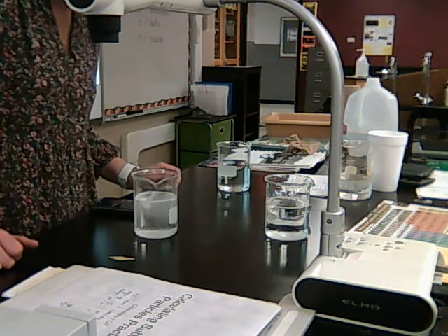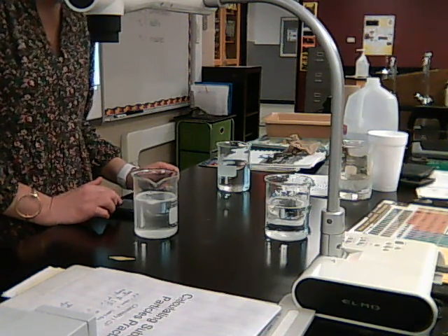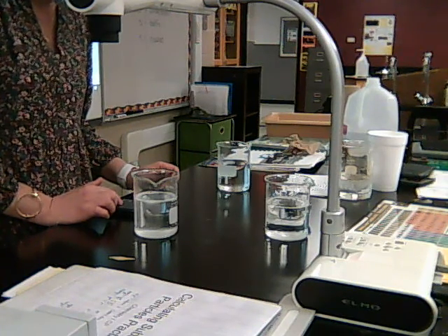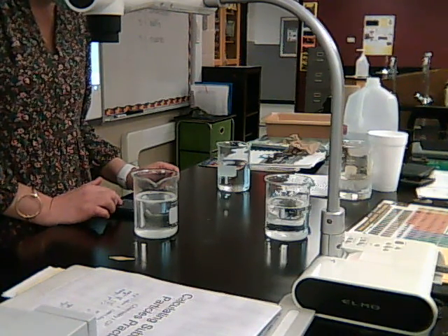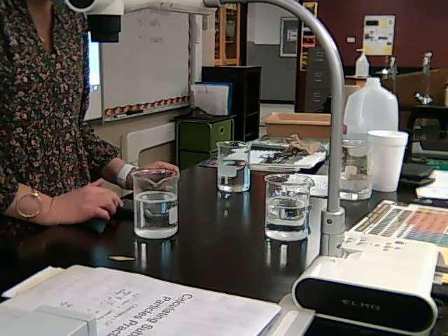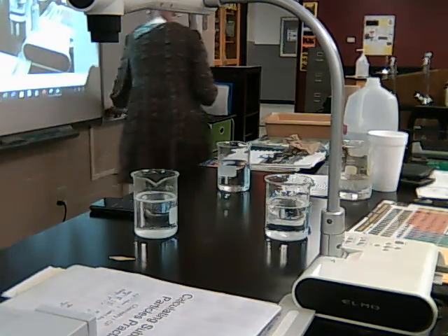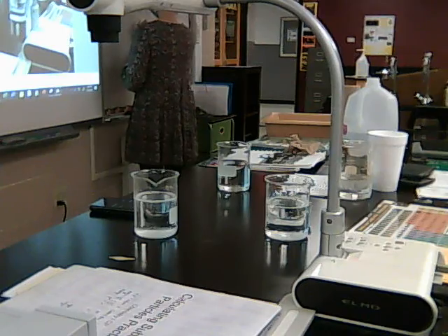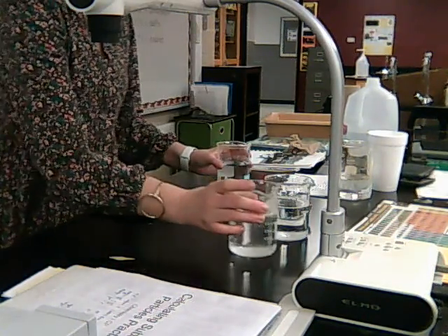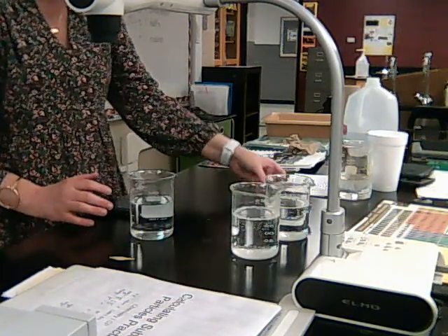Oh, there comes the other one. Okay, 53 seconds for the halves. Now we'll do, again, room temperature, we'll do the crushed.